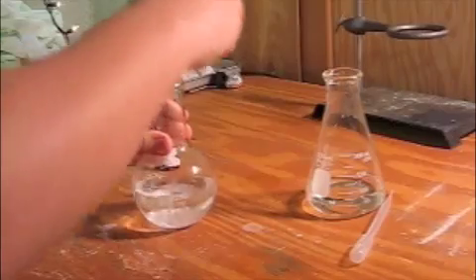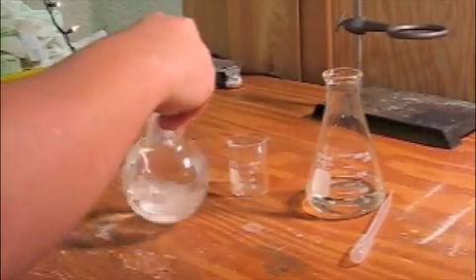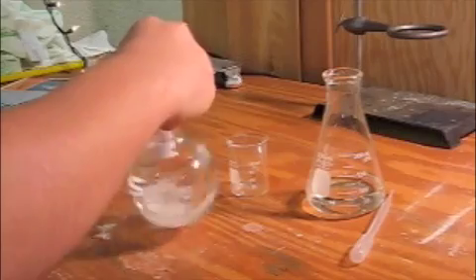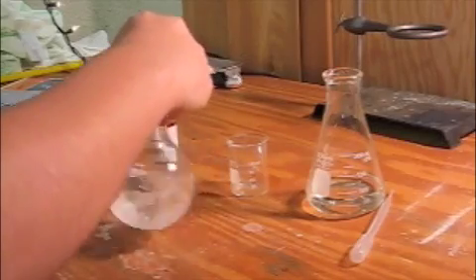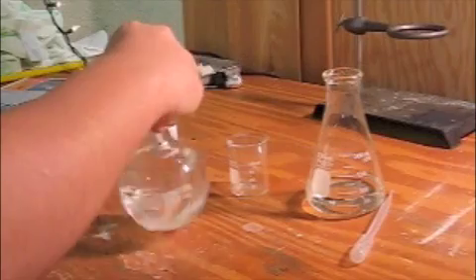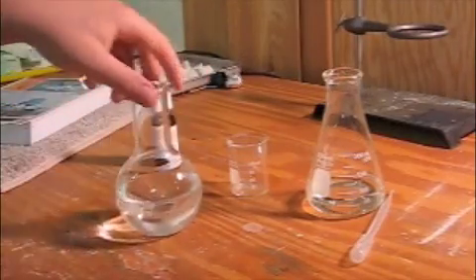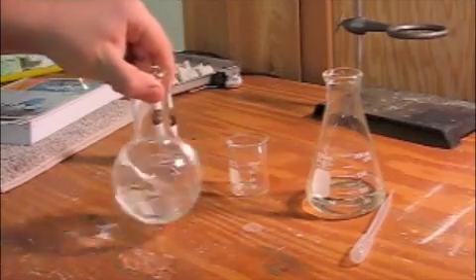First, to start out, I am adding some potassium iodide crystals to water in a flat-bottomed flask. I'm just swirling it. It's pretty soluble, as you can see.